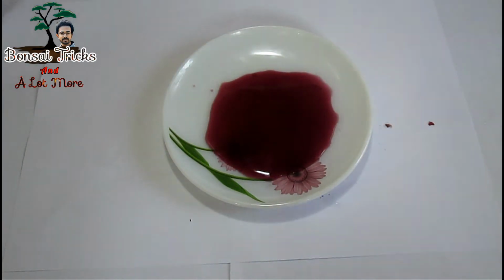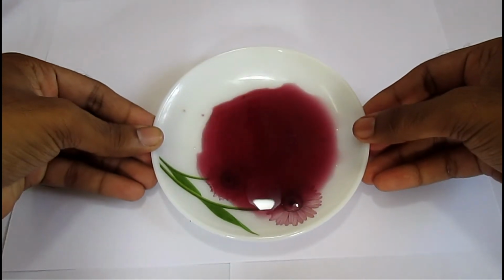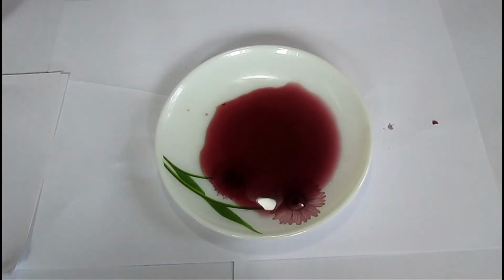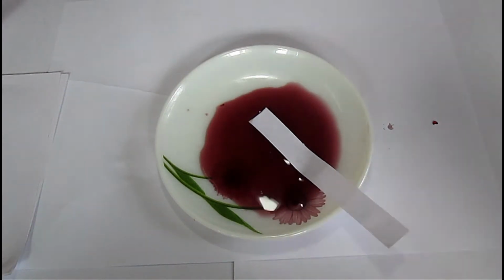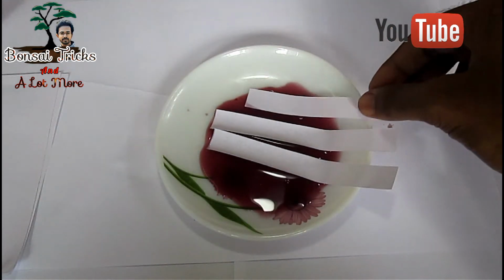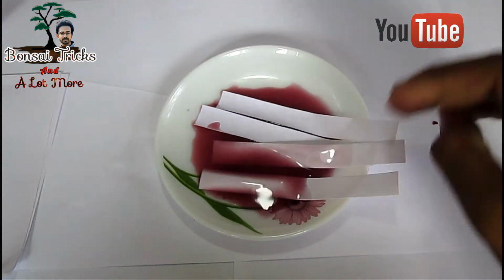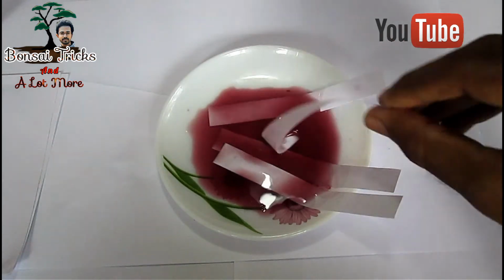The pH level of the rose juice is neutral, so it will turn green in basic solution and turn more reddish in acidic solution. Now take some filter paper. I don't have filter paper, so I have to use ordinary paper and scissor. If you use filter paper, that will be much better. Soak pieces of white paper or filter paper for 5 minutes until the rose juice gets absorbed by the paper.